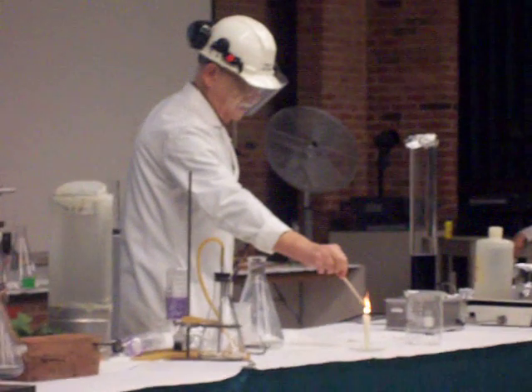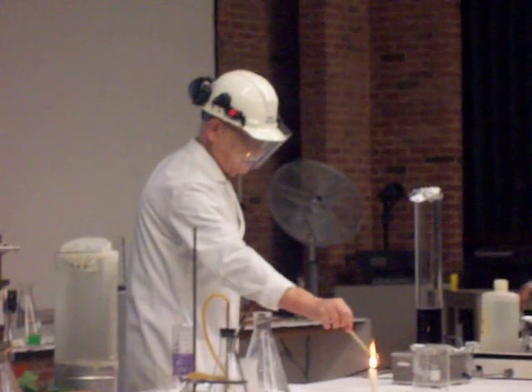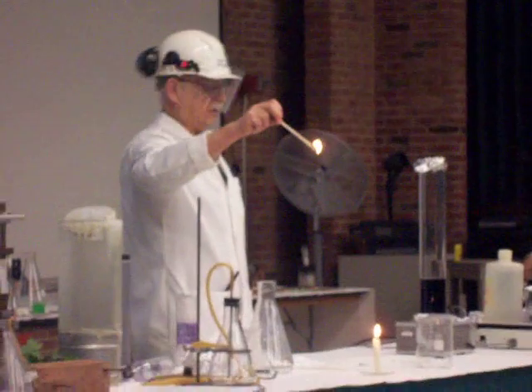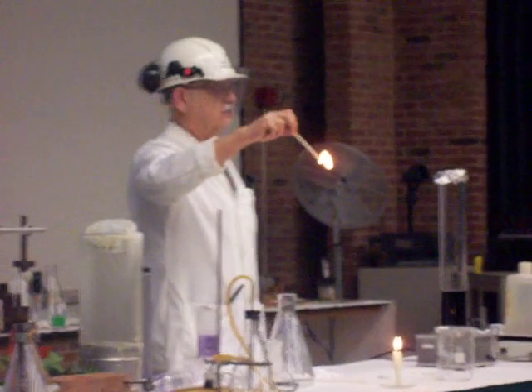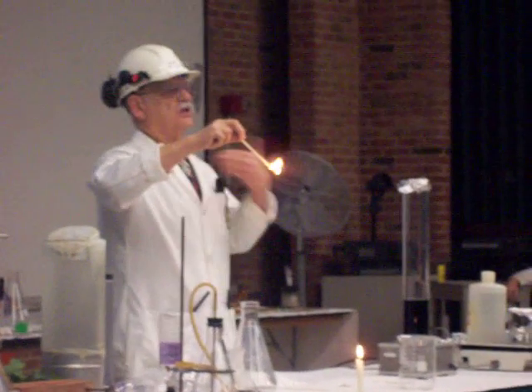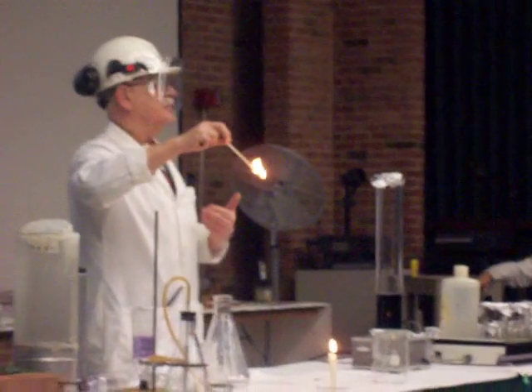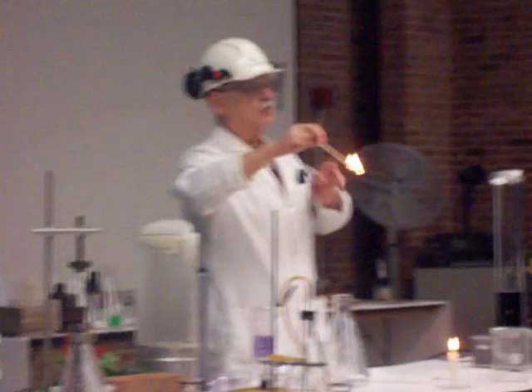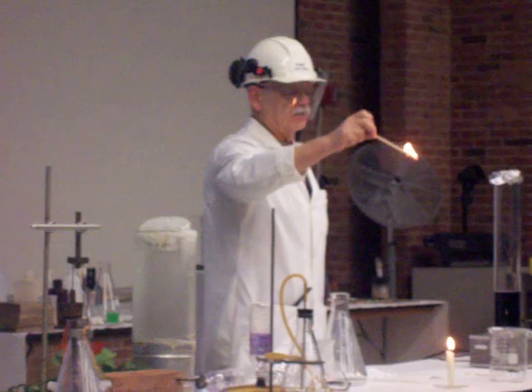The candle's flame is ignited — you see that it's actually burning, just as the candle's burning. These are chemical changes. We're changing the nature of the materials themselves. Atoms recombine from forming one kind of molecule to another.